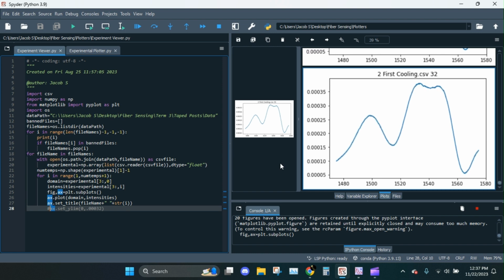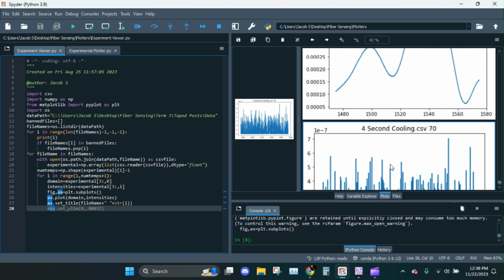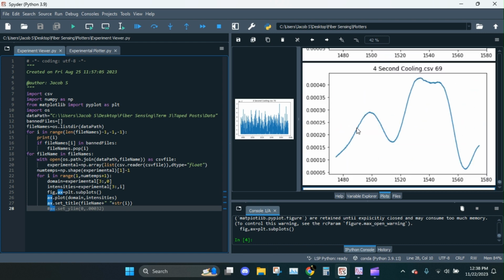What we're looking for is maxima that either disappear or go off screen. Because if any of them do that, we can't track them, so we shouldn't tell the program to try to track them. So far, everything's pretty stable, except for the last one. Okay, I'm going to assume that last one was, again, you must have halted the program in an improper way or something. So we're not going to include that last one. Other than that, the extrema seem pretty stable.